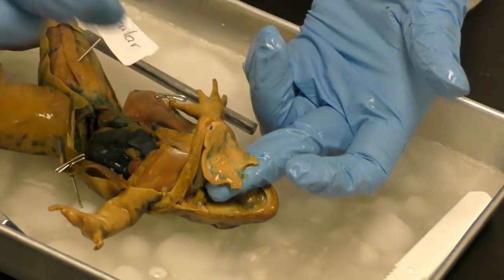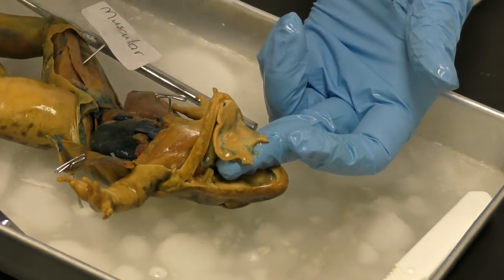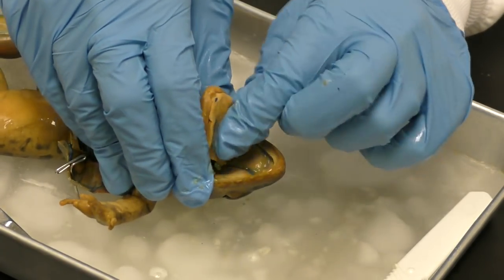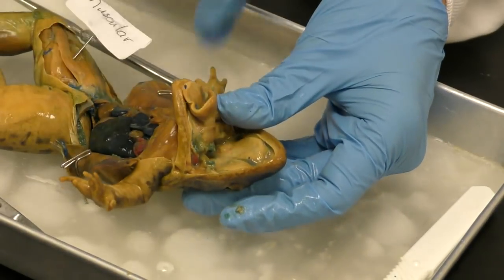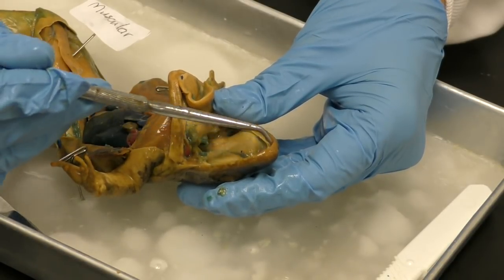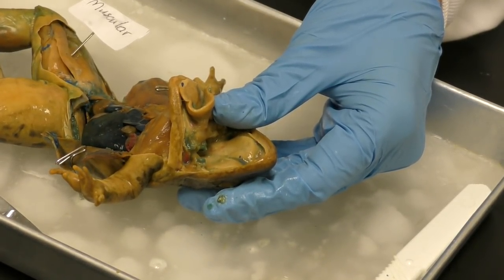All right, what I'm lifting up, this is not shaped anything like ours because ours is attached at the back of our throat, but this is the frog's tongue, and it'll come out and trap that bug. Okay, it's huge, huge tongue. Mouth, there's different kinds of teeth. There's vomerine teeth that help kind of crush the bugs before they swallow them. There's some teeth out on the edge.